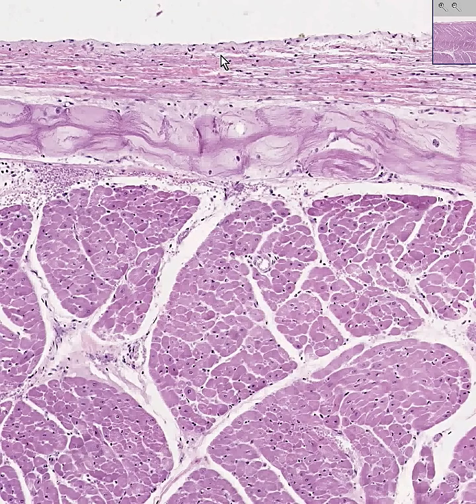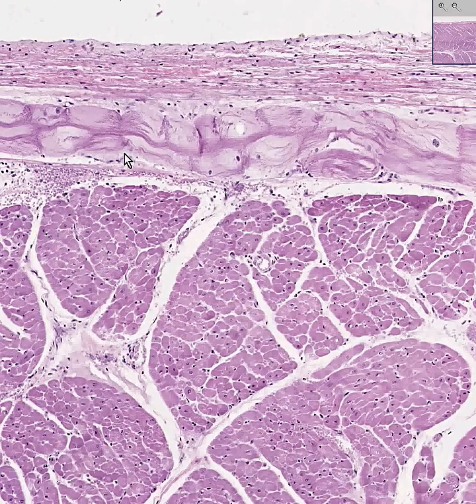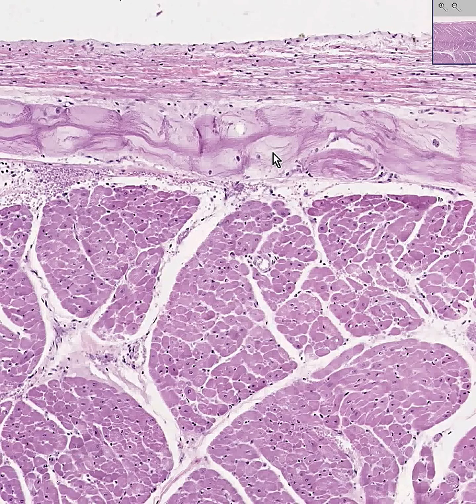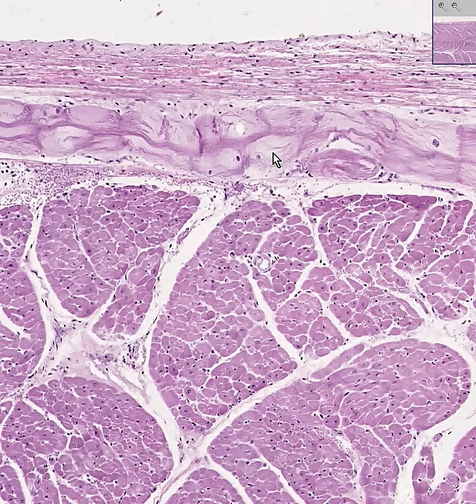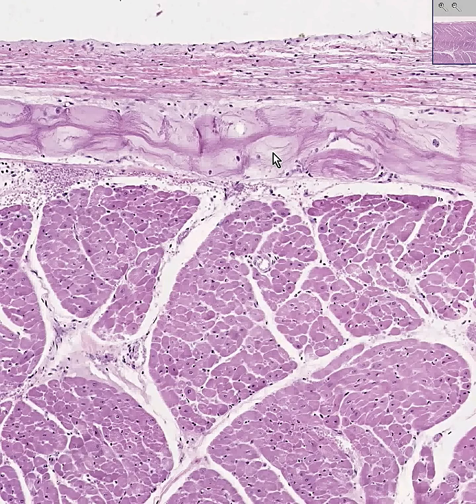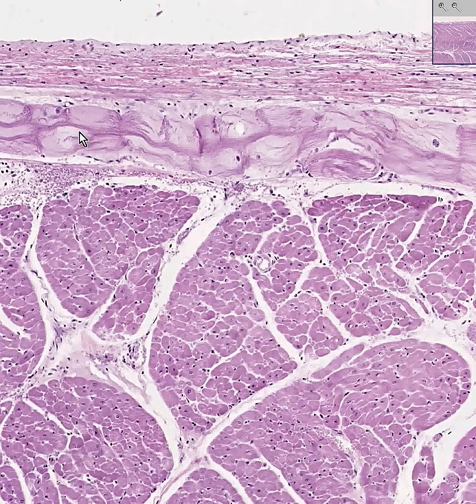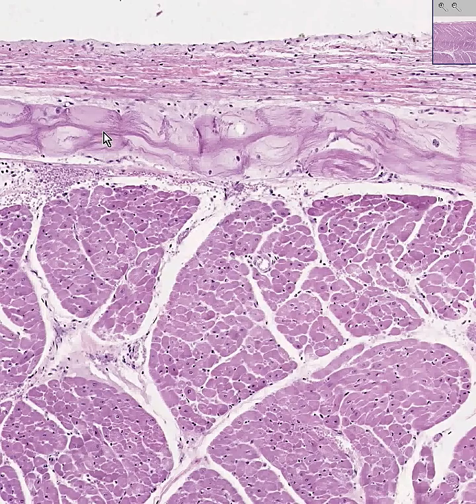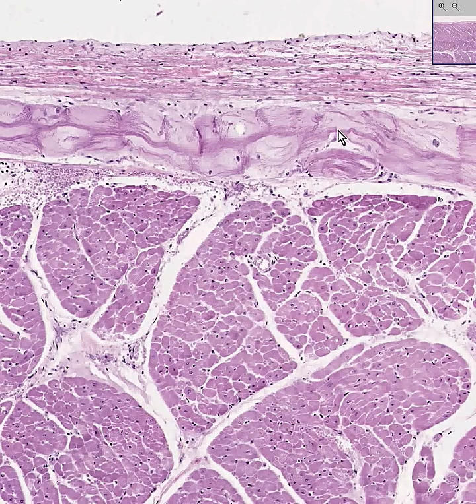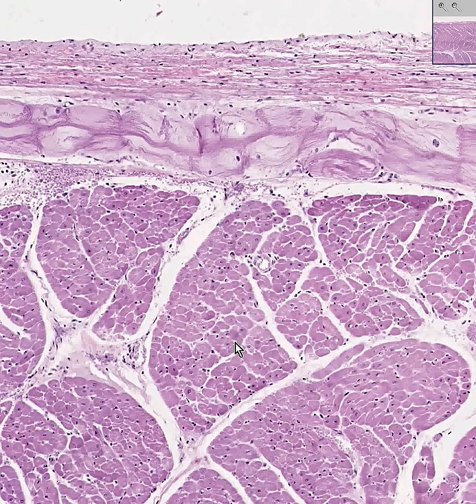Between the endocardium and the cardiac muscle, or the myocardium, are these funny-looking cells — they look like kind of bloated myocardial cells. In reality, they are modified myocardial cells, which conduct the electrical impulse throughout the endocardium chiefly, and then spread this in a precise timed fashion to various portions of the myocardium for synchronized contraction.